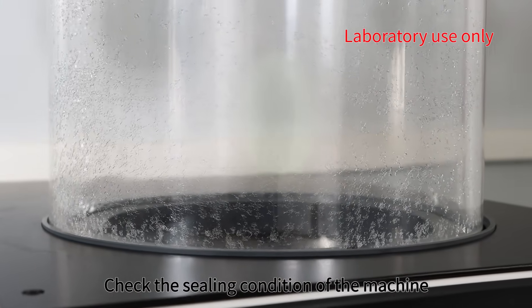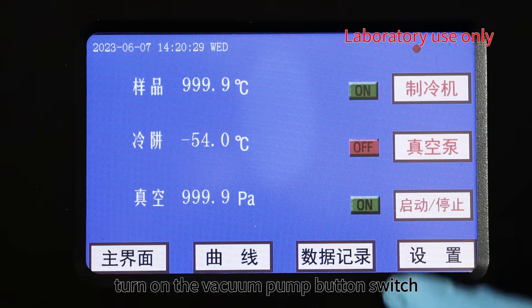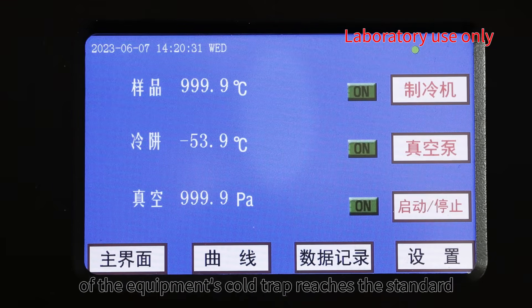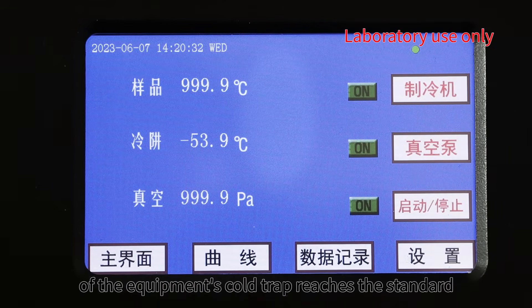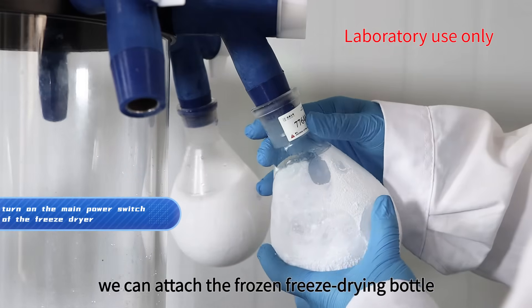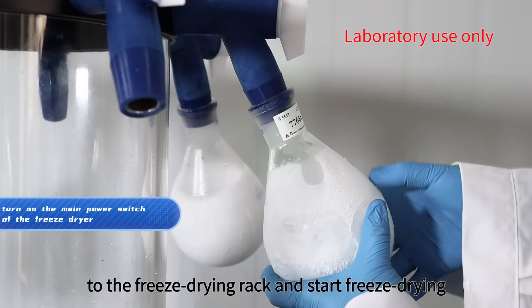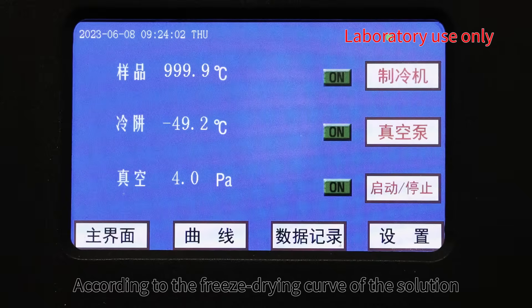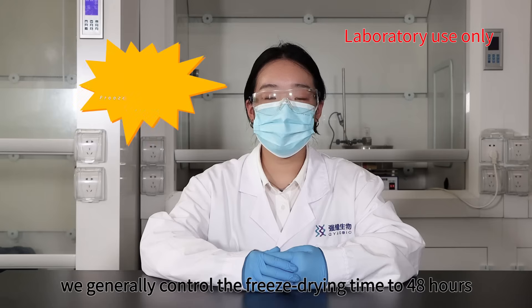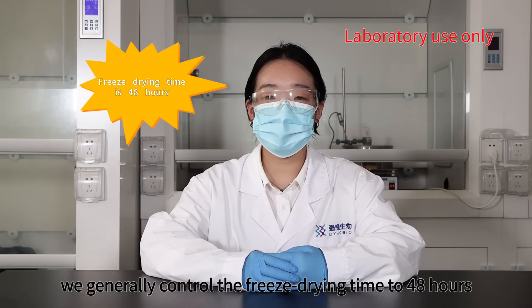Check the sealing condition of the machine and turn on the vacuum pump button switch. After the temperature of the equipment's cold trap reaches the standard, attach the frozen freeze-drying bottle to the freeze-drying rack and start freeze-drying. According to the freeze-drying curve of the solution, we generally control the freeze-drying time to 48 hours.